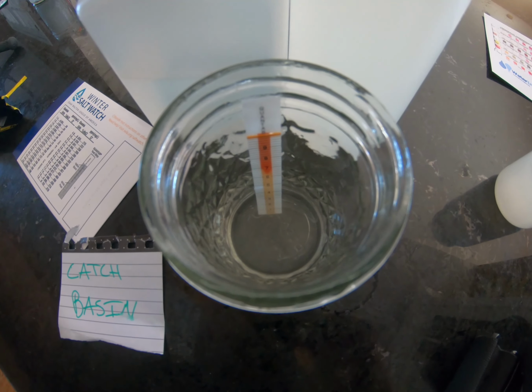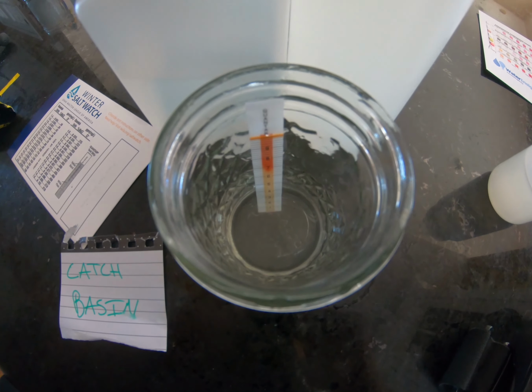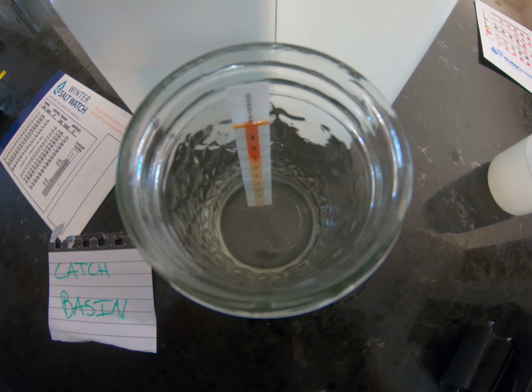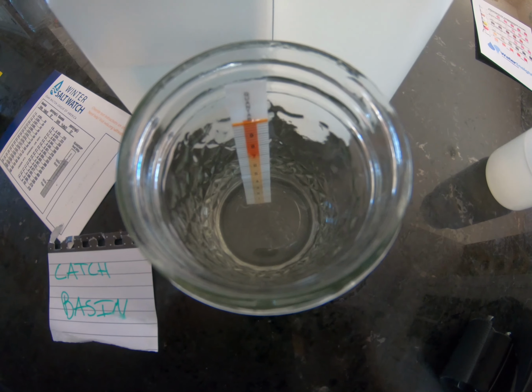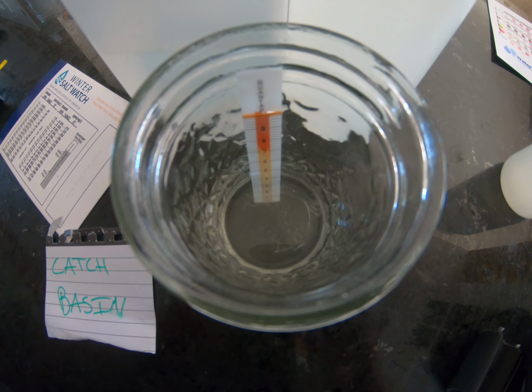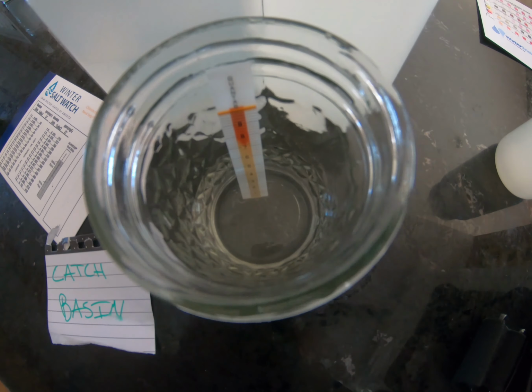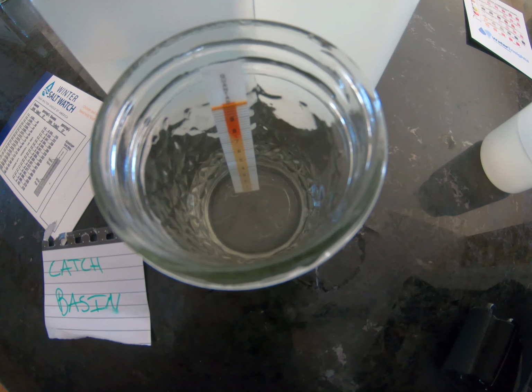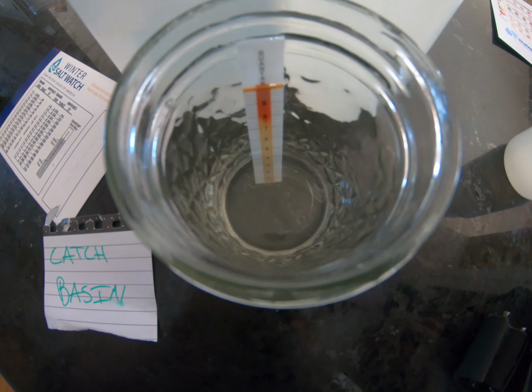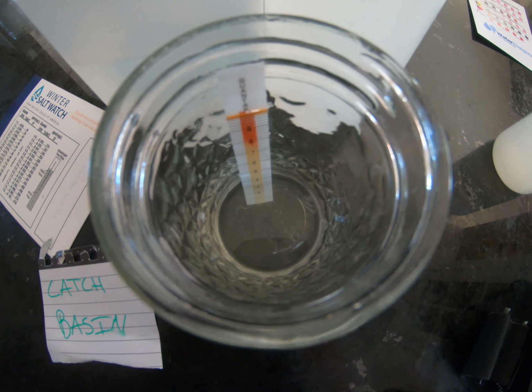For my 2 sites, the stream and the catch basin, I received radically different results. The stream was fairly normal at around 30 ppm or milligrams per liter of chloride ions. It ran only about to the 1.4 mark on the test strip. The catch basin, on the other hand, ran past their indicator chart all the way up to the 9 on their test strip. This indicates a chloride level of above 618 milligrams per liter of chloride.